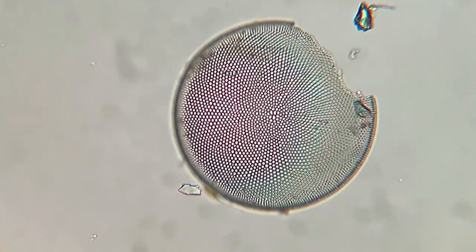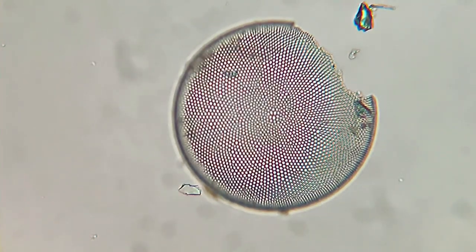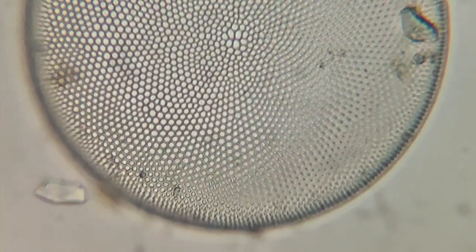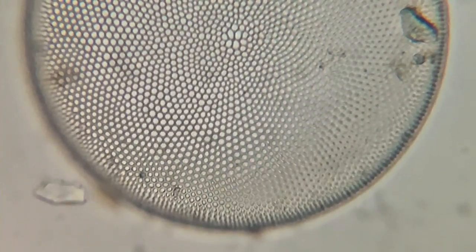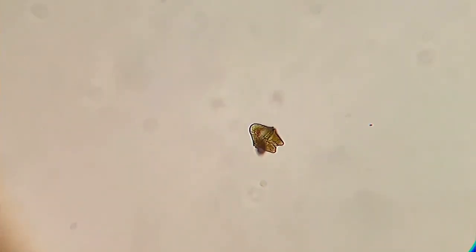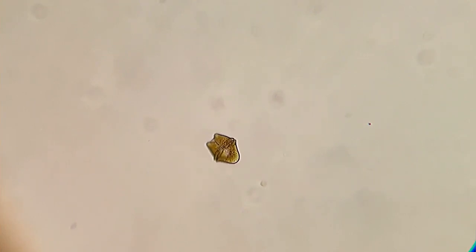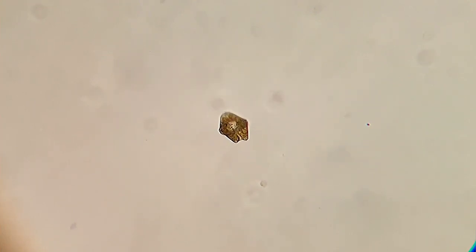Check out this incredible pattern. This organism that looks like a spaceship is a dinoflagellate.